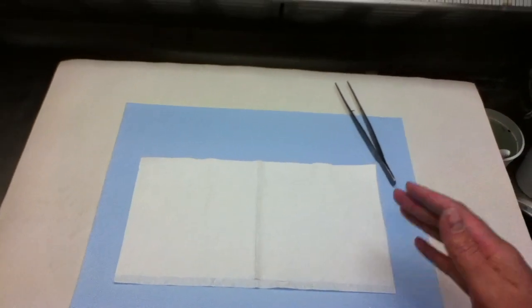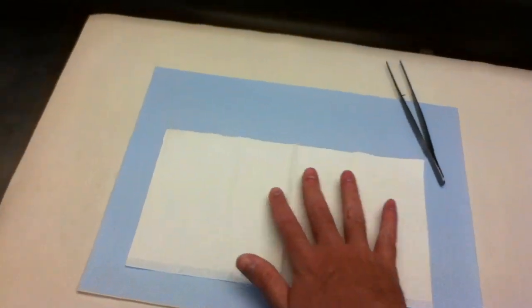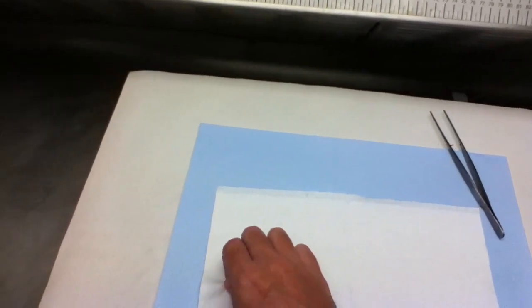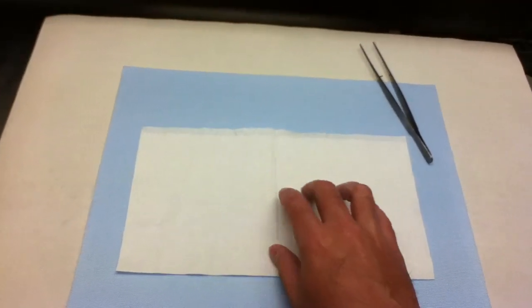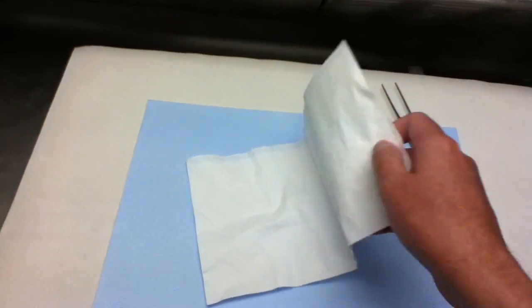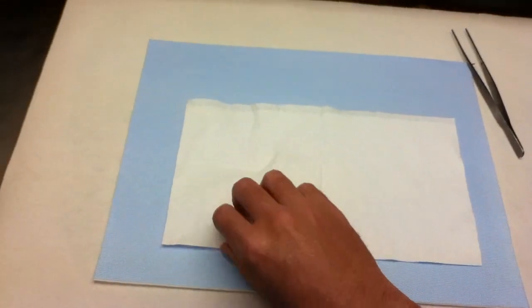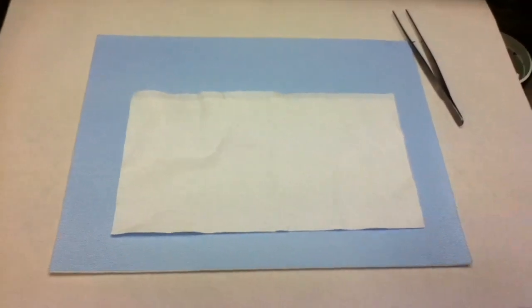Mainly what I work on most of the time are these little white balls — little white absorbent soft pads. They hold up my blades well. Every time one gets soiled, any decent-sized specimen, I'll wrap the specimen up in it, shove it in the specimen container, and it just goes away. Then I pull down a new one. This helps with cross-contamination and keeping the bay clean.